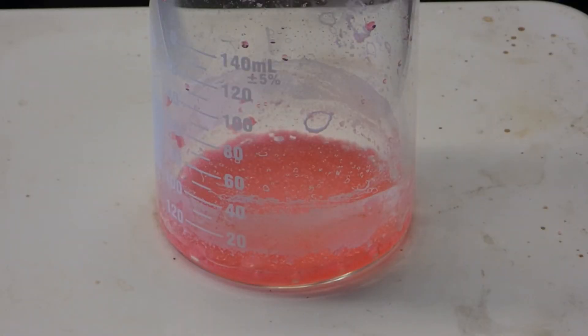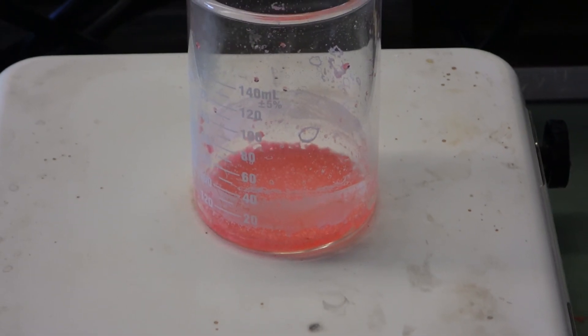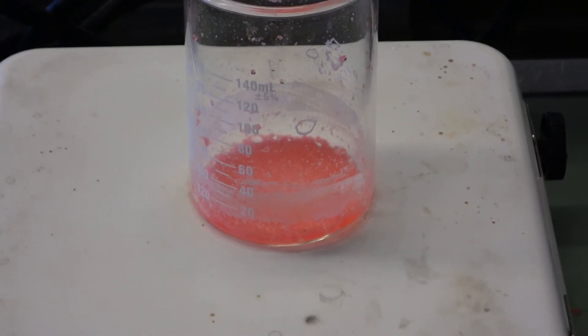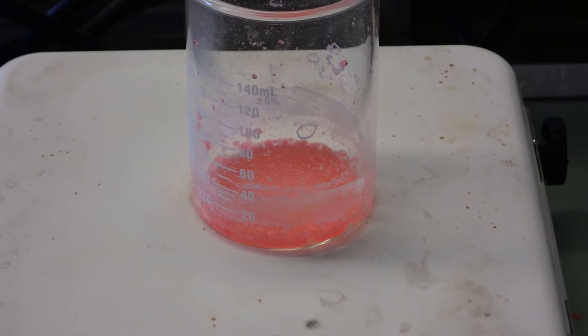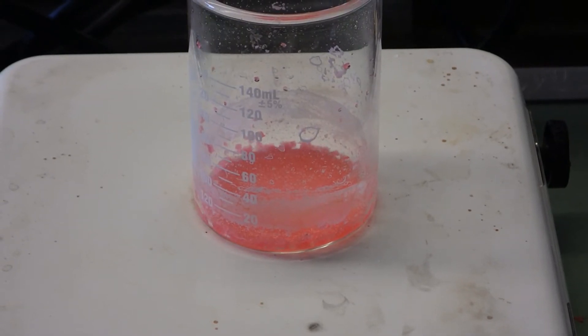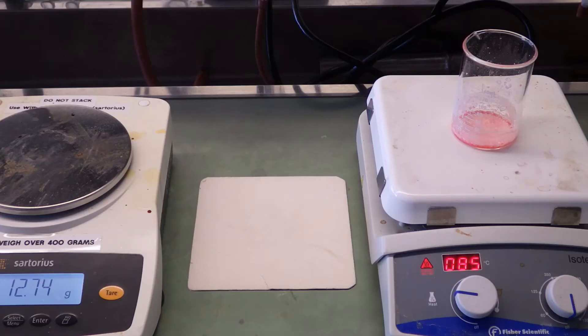Here it's starting to spatter. If any of the solids hop out of the beaker, we lose some. So I'll need to take that off the hot plate and let that cool off a bit before heating it some more. So here it's been heated for some time now.